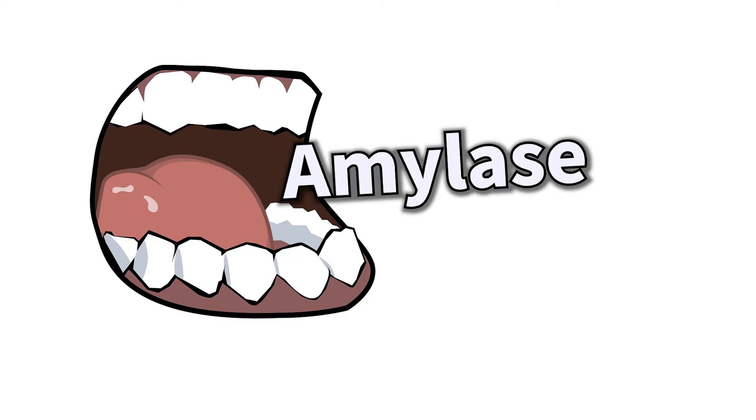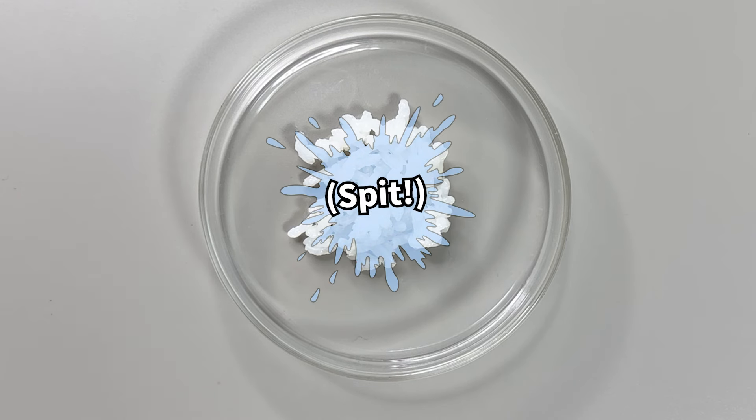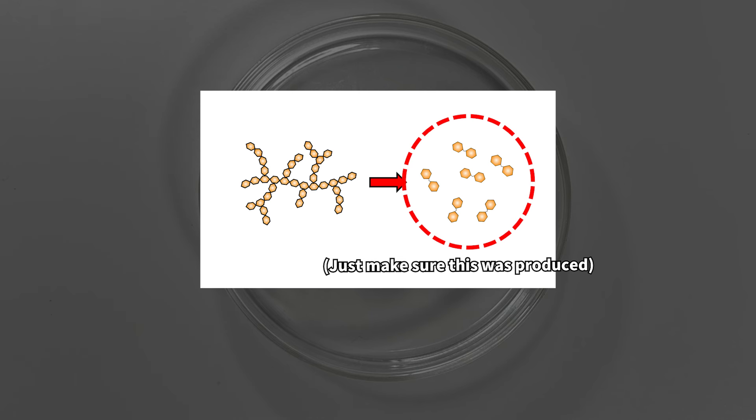To detect amylase in saliva, we mixed a starch-based substance with the saliva, and observed whether any starch breakdown occurred.